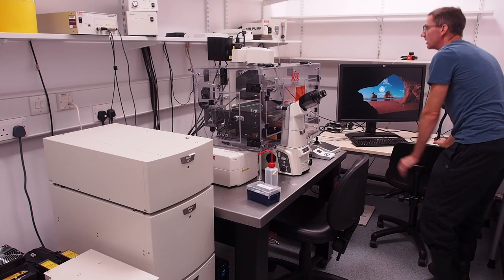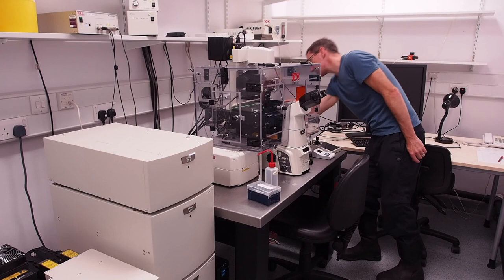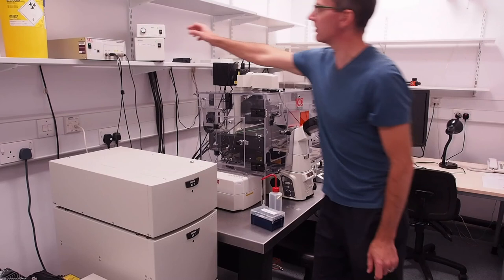Switch off the power for the camera if you used it, switch off the microscope body. This is with the switch situated right at the back on the right of the microscope just below the epifluorescence launch tube. Above the microscope on the left switch off the stage controller and halogen lamp and then the Z drive.